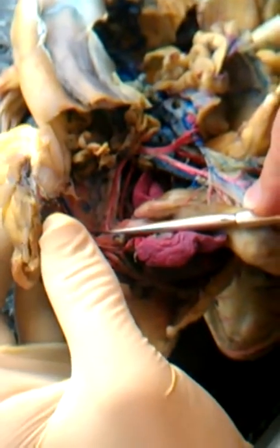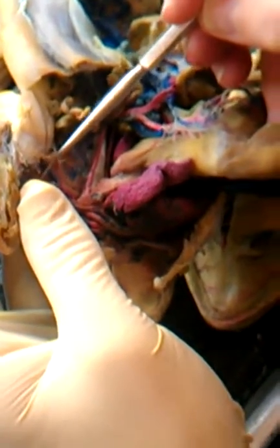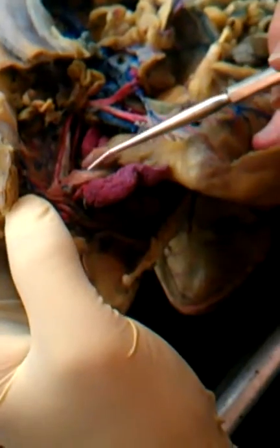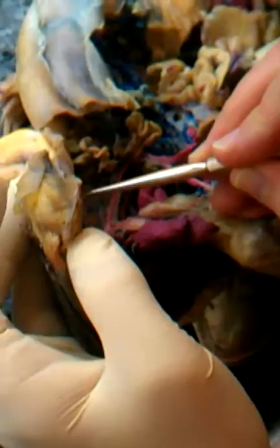It's subclavian as long as it's in the thorax. Once it gets out in the forelimb, so about right here, the name changes to brachial artery. So just like some roads change name when you get past a certain city or another side street, that's what happens with this one. It goes from subclavian in the thorax to brachial once it actually gets into the arm region, the forelimb region. The last one is occipital-vertebral.